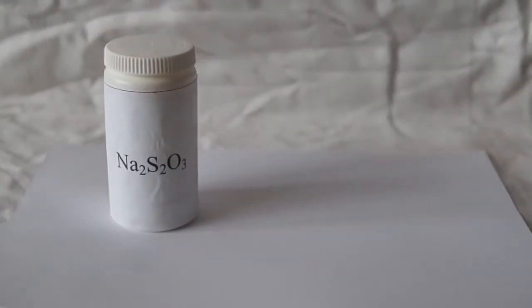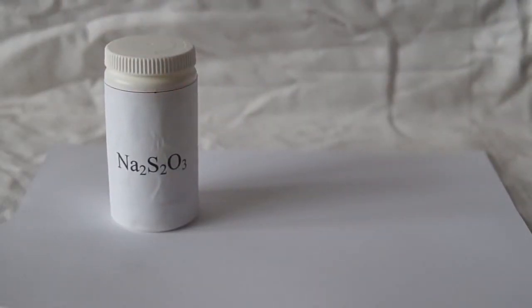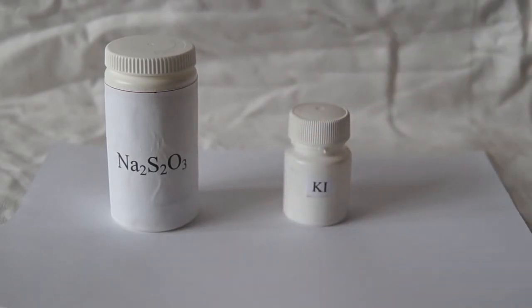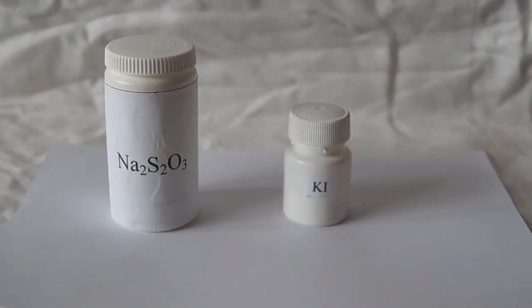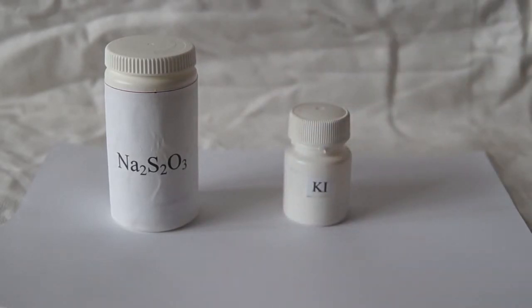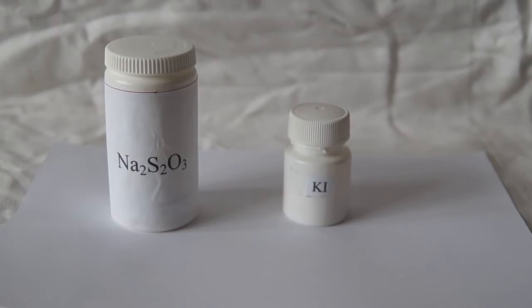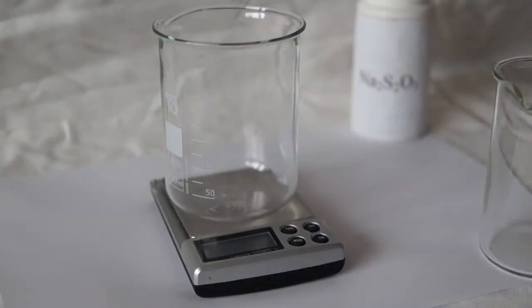Hello everyone! Today we'll have a very unusual chemical reaction called Egyptian Night, or the simplified version of the chemical pendulum.